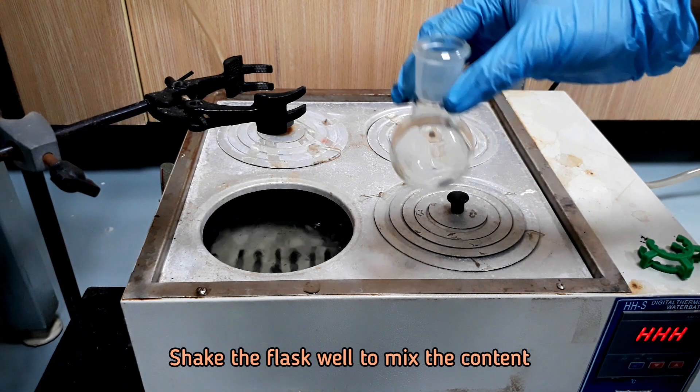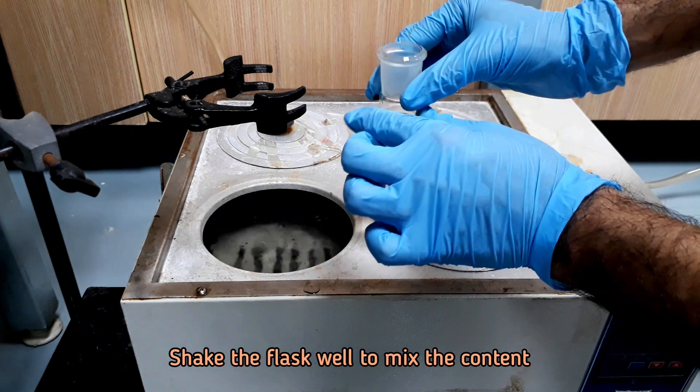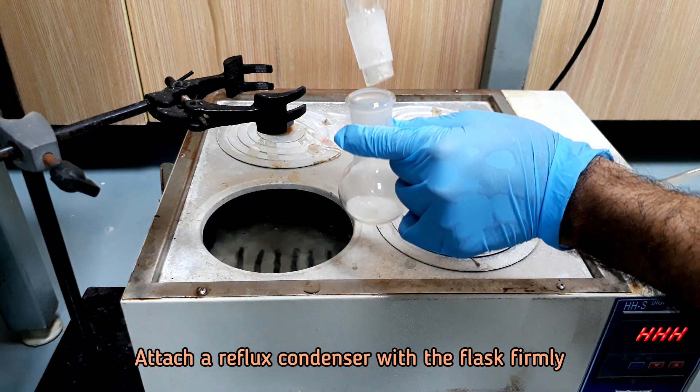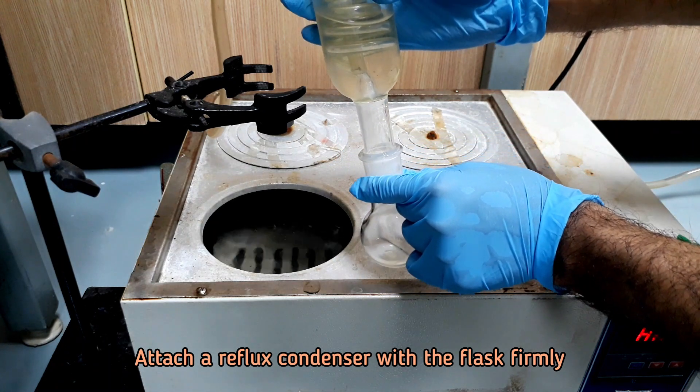Shake the flask well to mix the content. Attach a reflux condenser with the flask and heat at boiling point using a water bath.